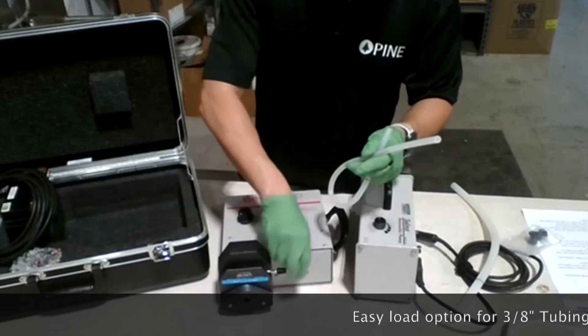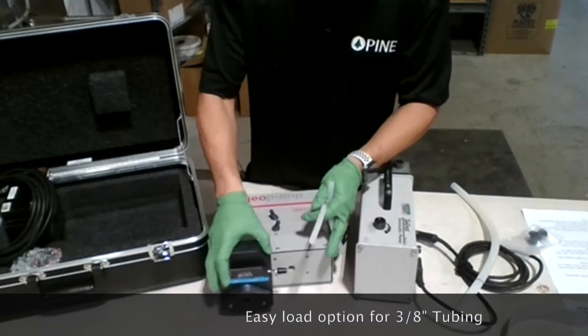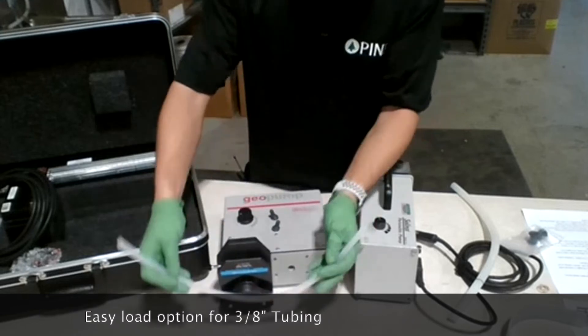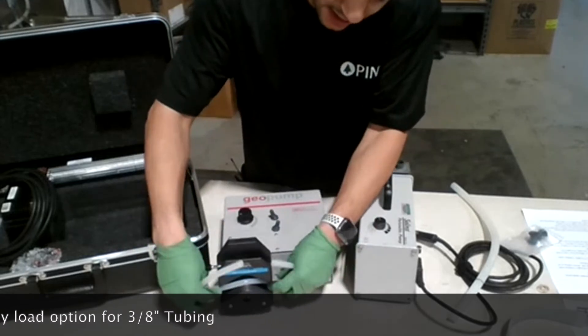I'm going to show you exactly how to do it. When it's closed, you just pull the lever up and then you just put the tubing inside.